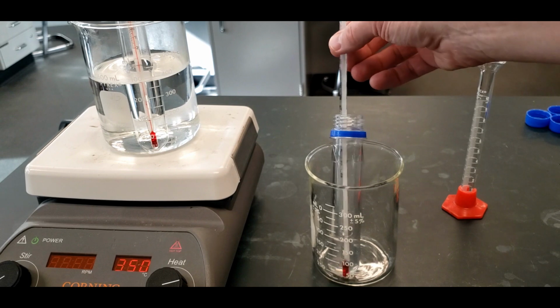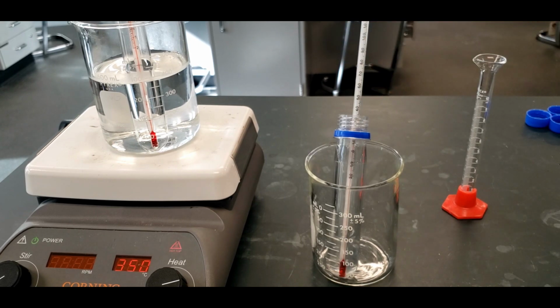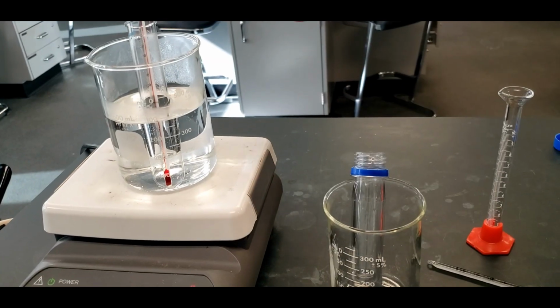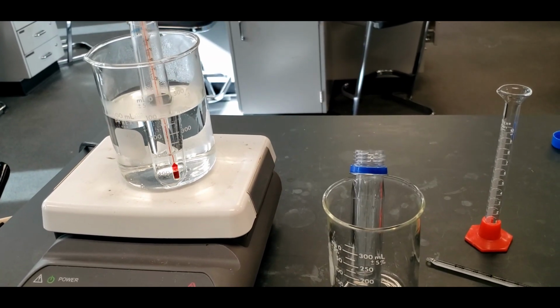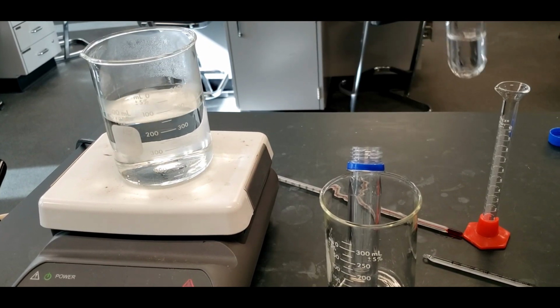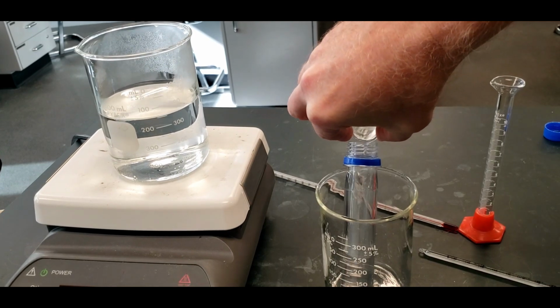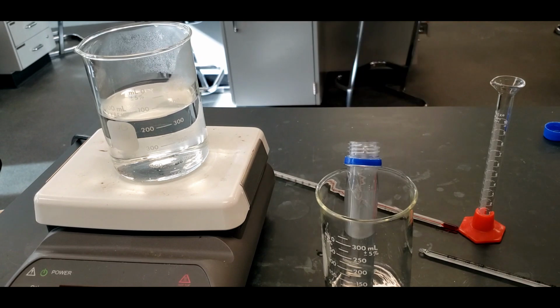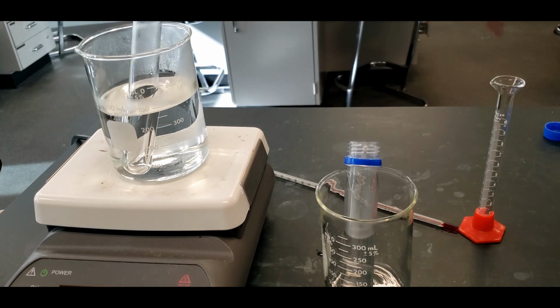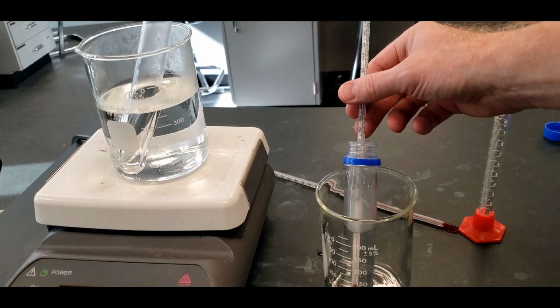Okay, and the temperature at room temperature here is 21.5. All right, so this is at 65 degrees. And one of the reasons not to let it go too much hotter is that I can pour it now without hurting myself, burning my fingers. Put that in. Then we're going to put in the thermometer and see where it ends up.